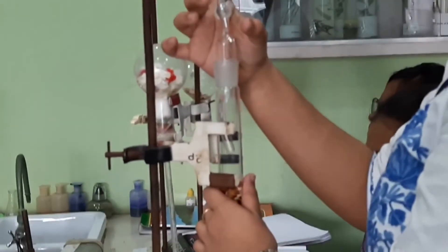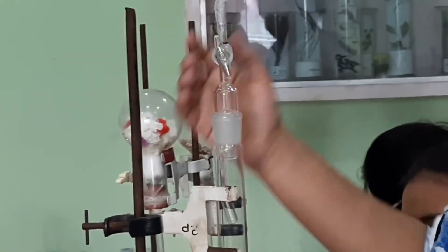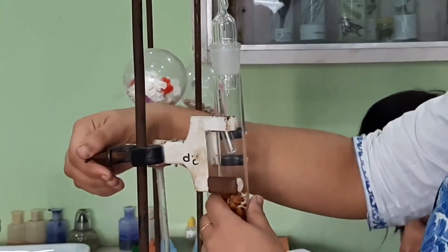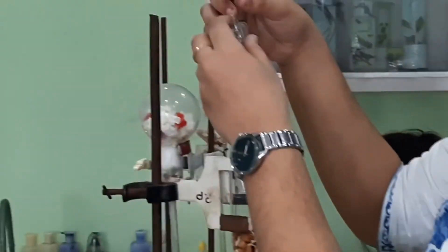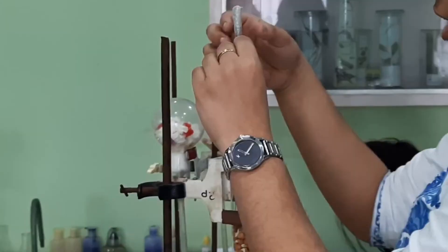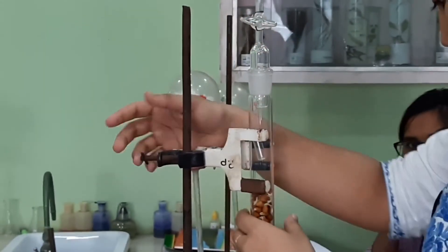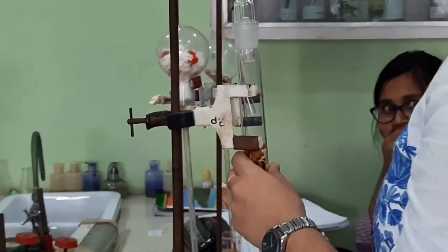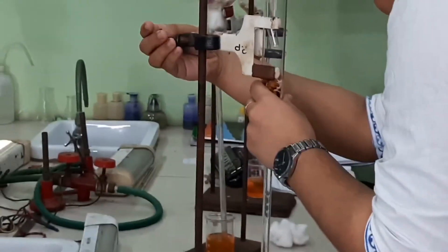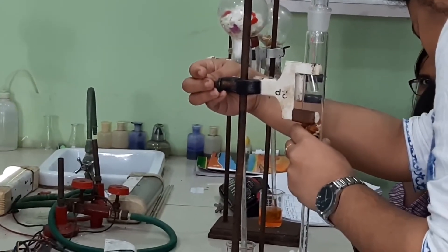This apparatus is much more standardized. From the beginning of the setup, there is an opening at the top which can be made airtight with the help of a tap. Opening the tap allows a little brine water to be sucked in to an initial level, then close the tap. There is a small tube attached along with the stopper for storing the KOH pellets inside, and the reservoir will hold the gram seeds. The setup is done and now we will observe the recorded data and do the calculations.